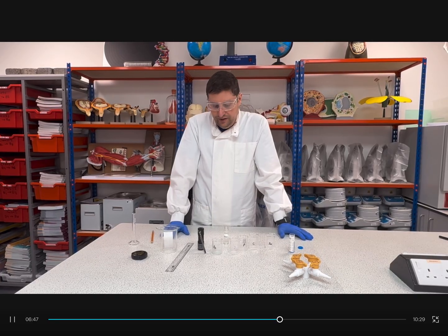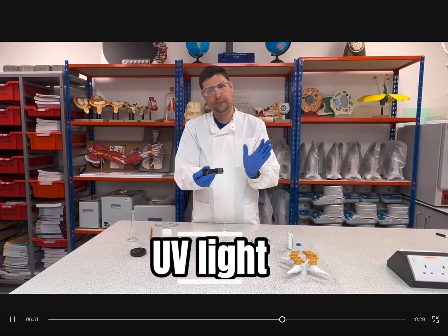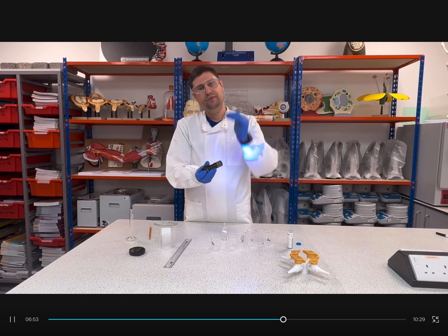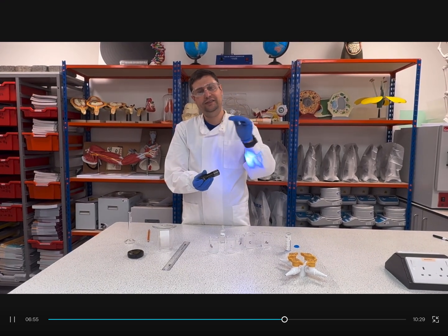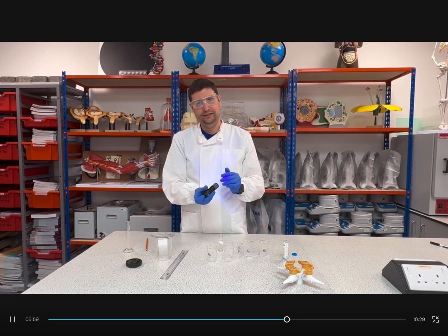After it is dry, we will use our UV light to see the position of each sample in the solvent on the TLC plate. Okay?